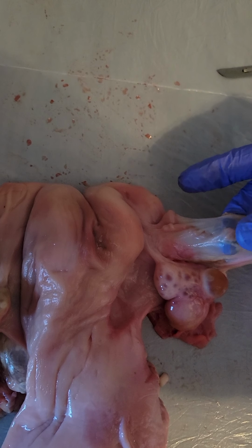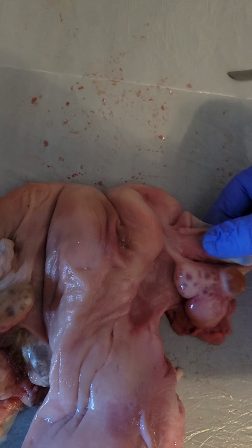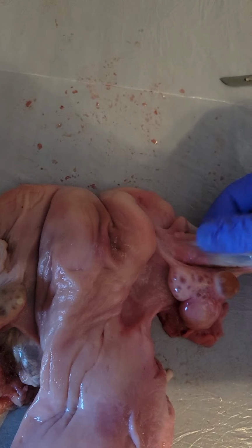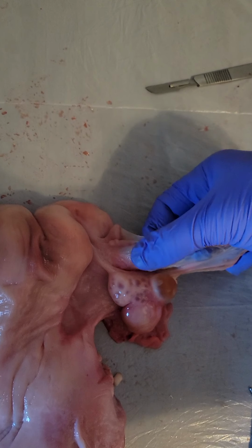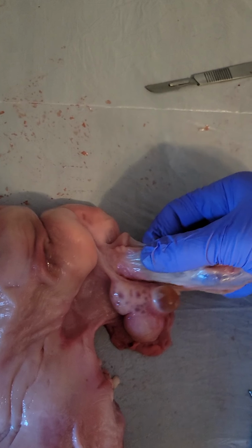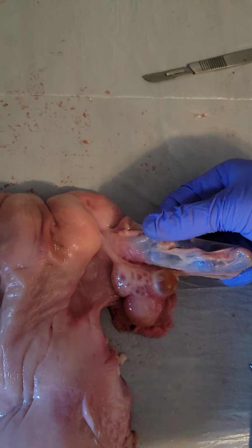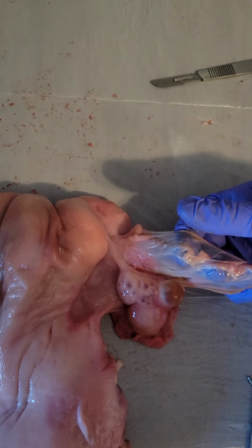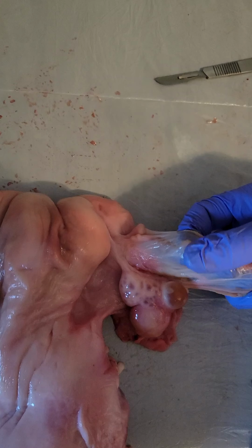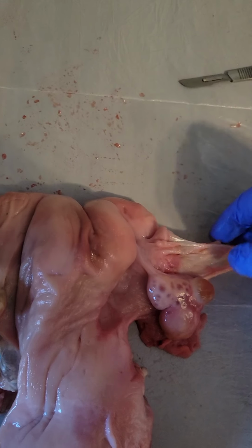where is it? Right about here. Because then it becomes harder. Kind of, how did you explain it? The al dente noodle. It's just the isthmus, which is where the sperm cell, the isthmus ampulla junction is where the sperm cell will meet the egg and fertilize. So right around here.